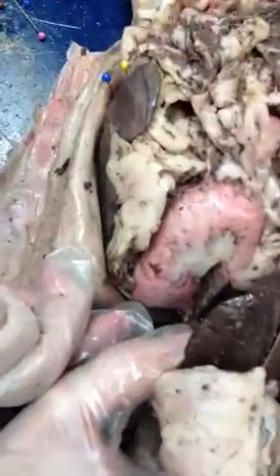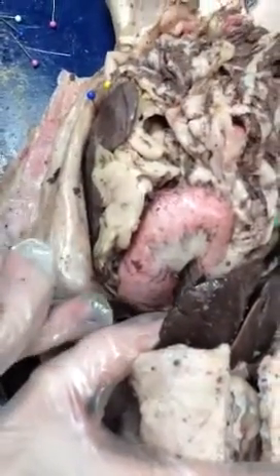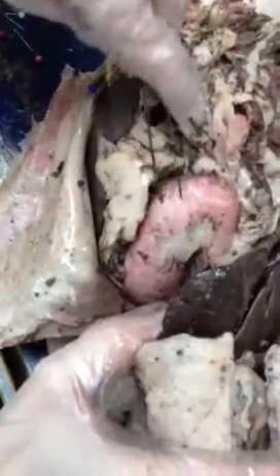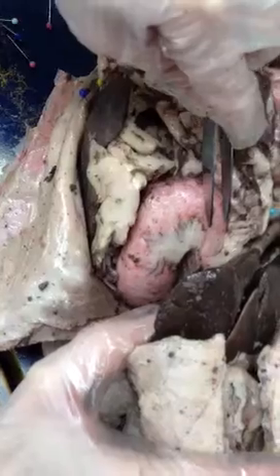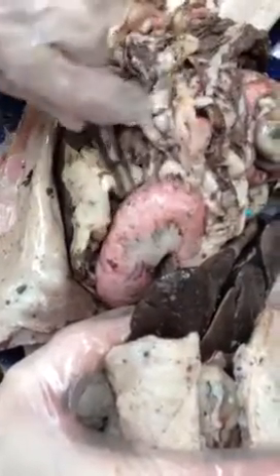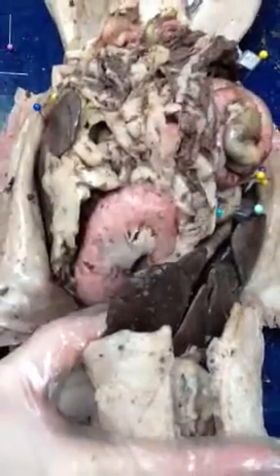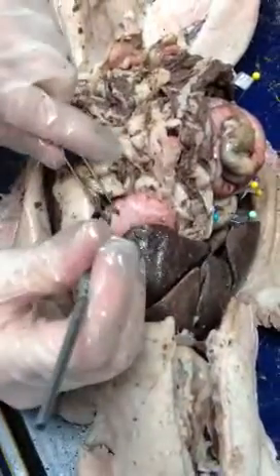All right, so we'll start up here with the stomach. If it's pinned up here near the esophagus, that's going to be the cardiac or cardia region. Then we have the fundus, which is this top portion. Anything else in the middle is the body. Anything at the end is the pylorus. The outer edge is the greater curvature, because that's where the greater omentum attaches. And the inner edge is the lesser curvature.